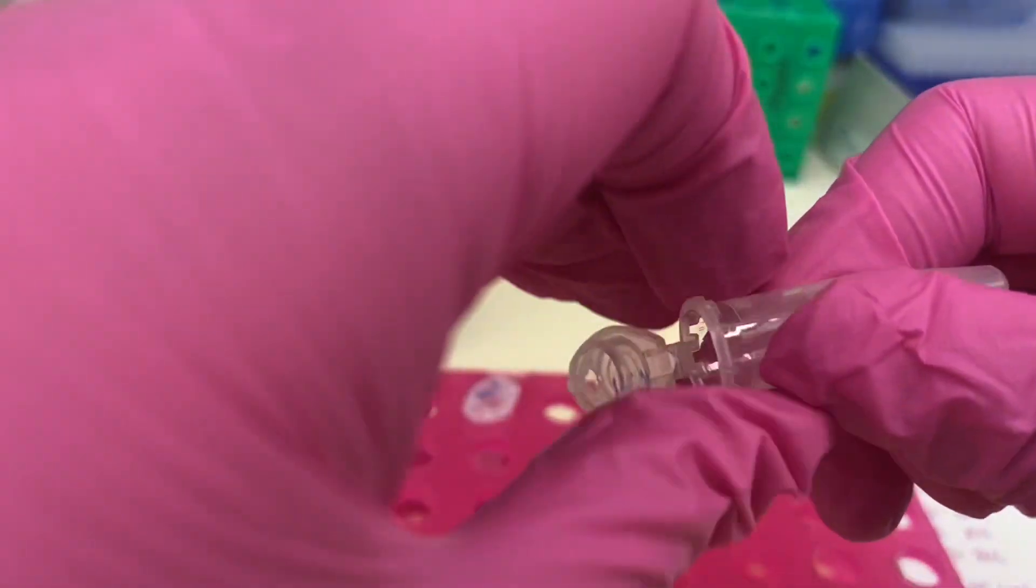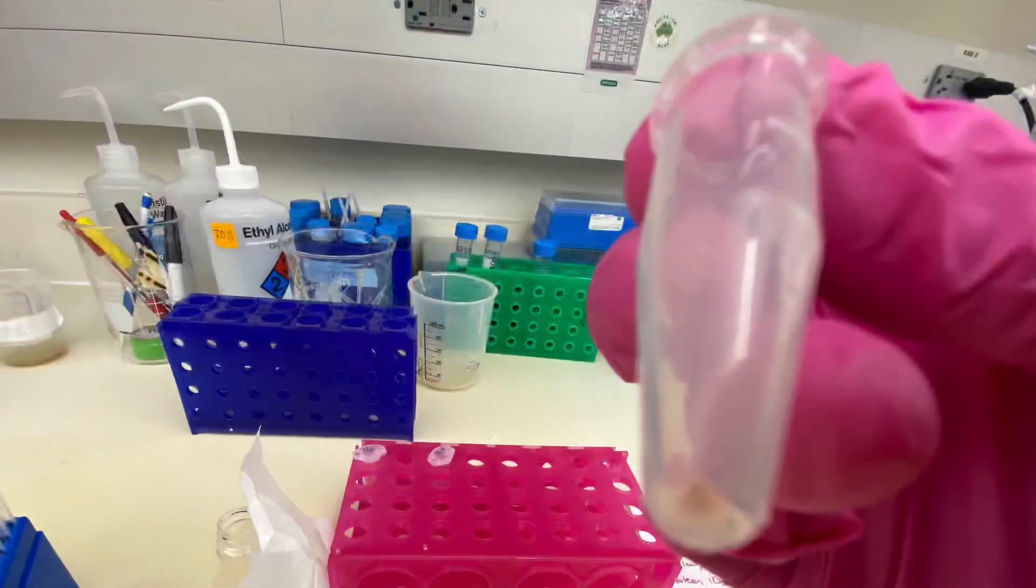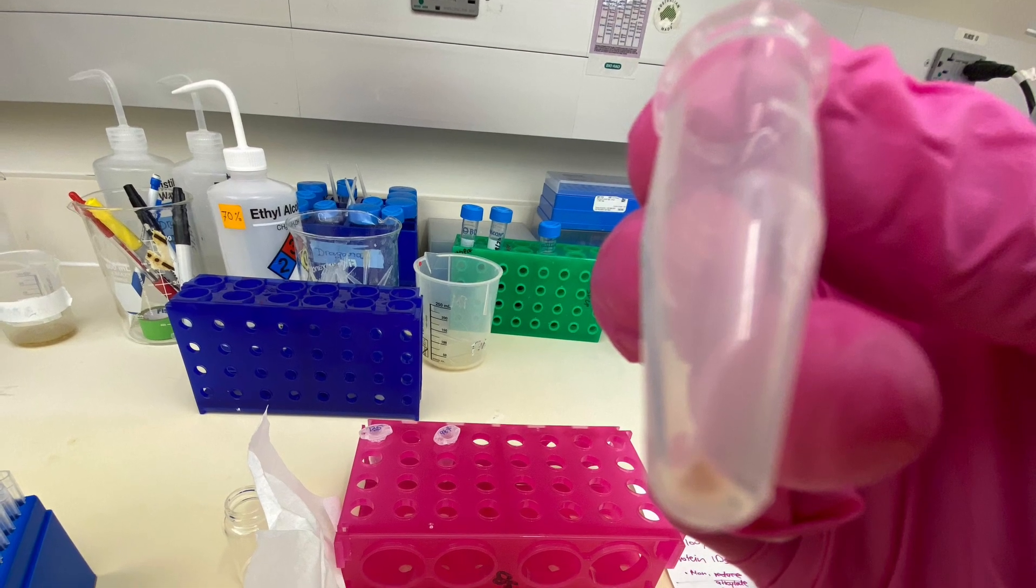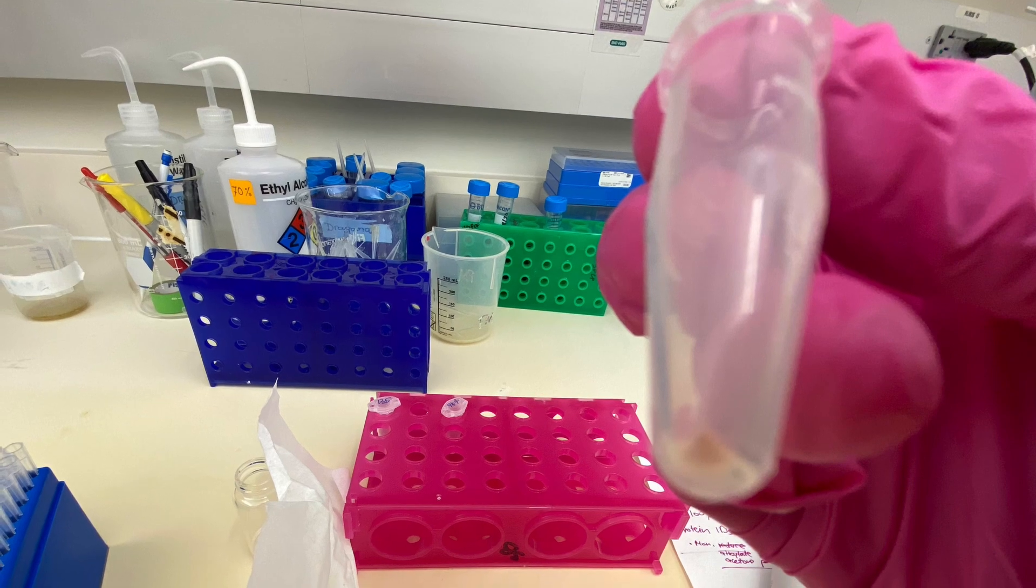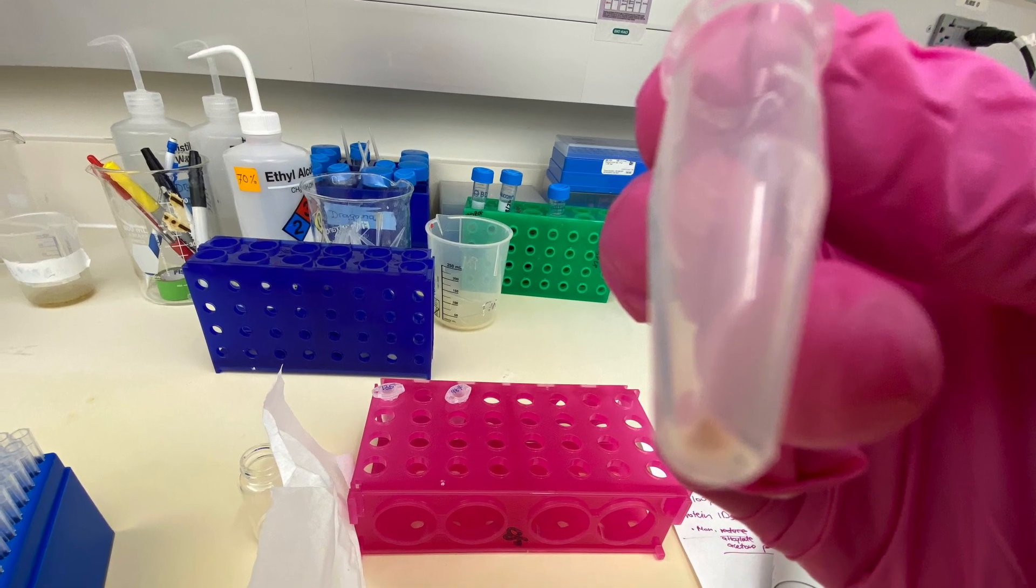You can see here how it looks like. I will just leave this at room temperature for maybe five minutes so I'm sure that the acetone evaporated completely.